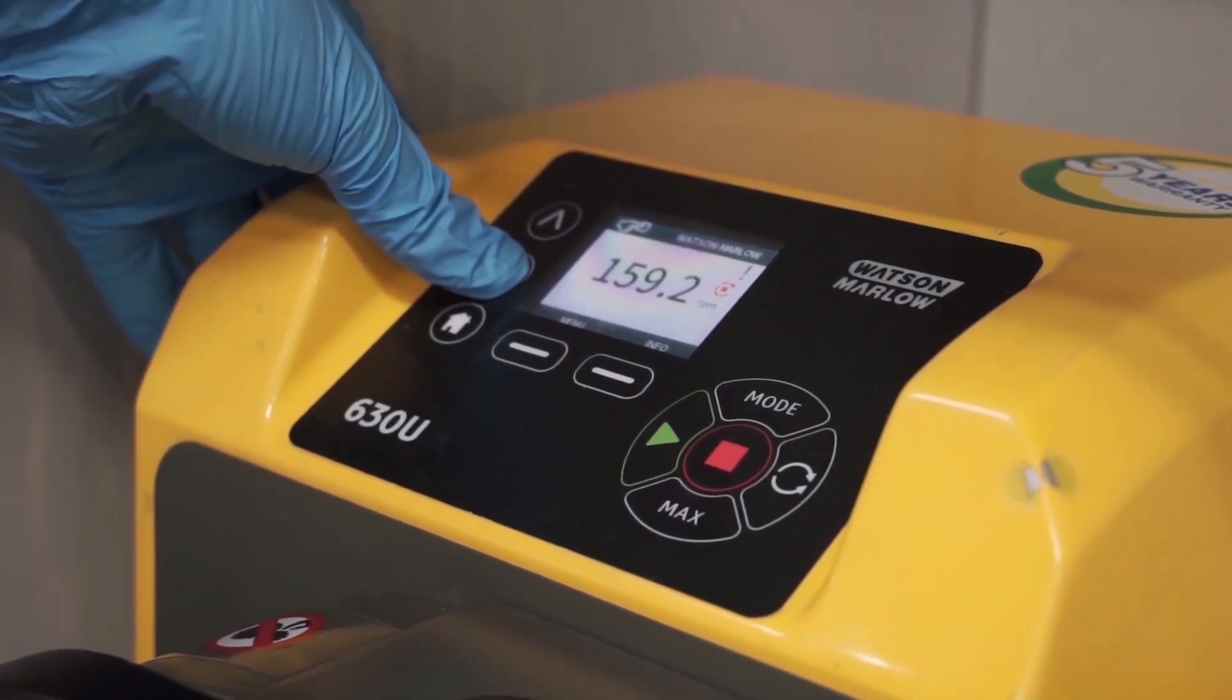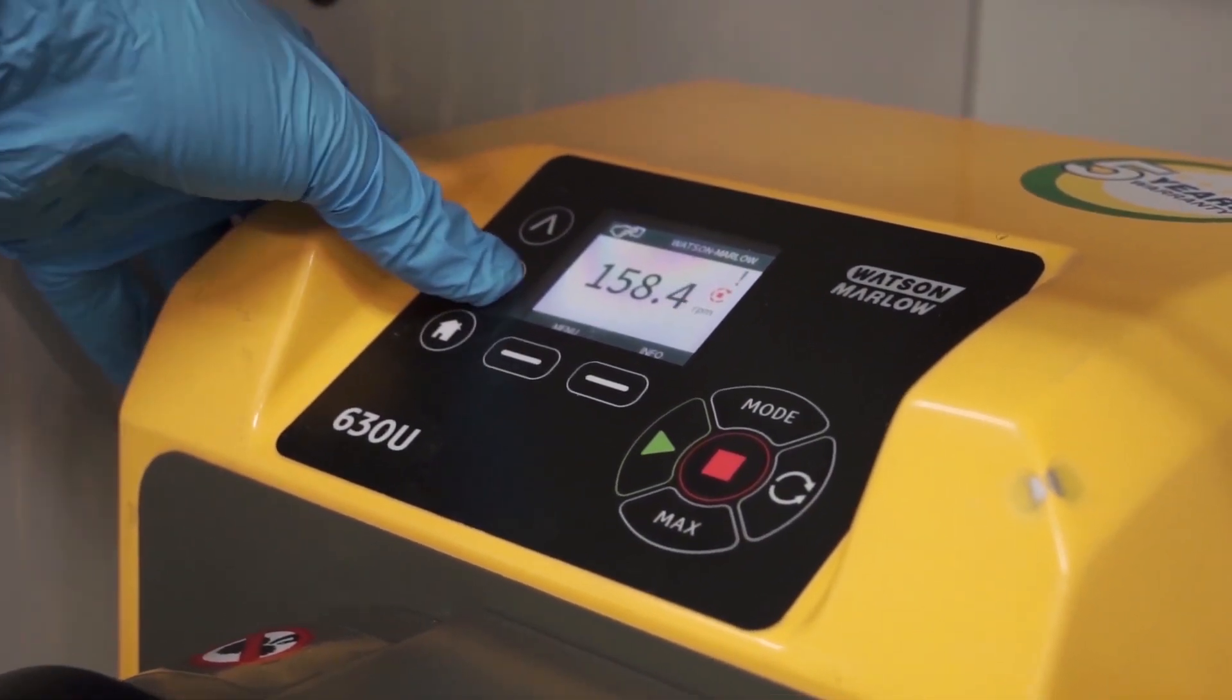Repeat this procedure at least three times by varying the nominal pump flows.